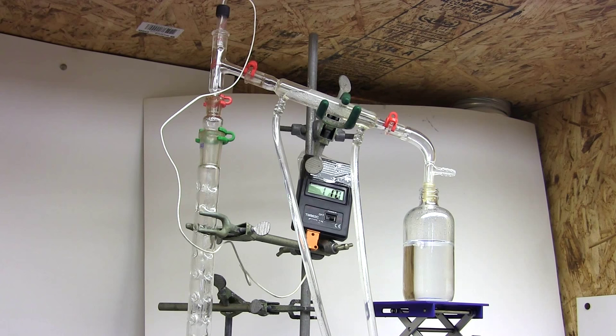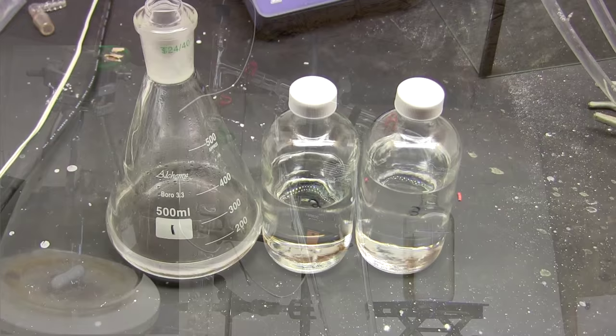Although looking back at how badly the methyl ethyl ketone and toluene have overlapped I'm starting to think water mixing might have been viable. Oh well, at least I have pure toluene now. And we are done. The source flask just has some impurities so we're going to turn off the heat and let it all cool.